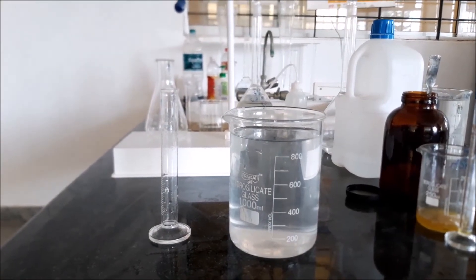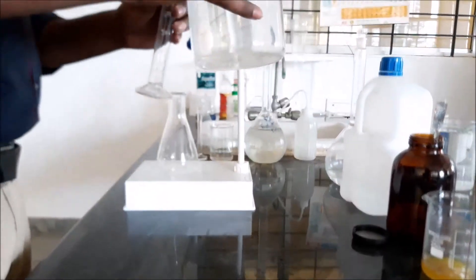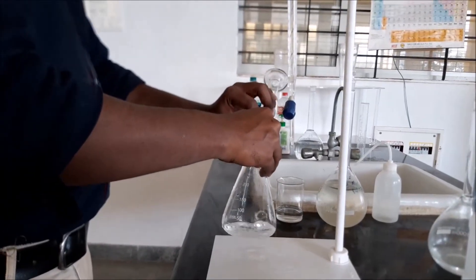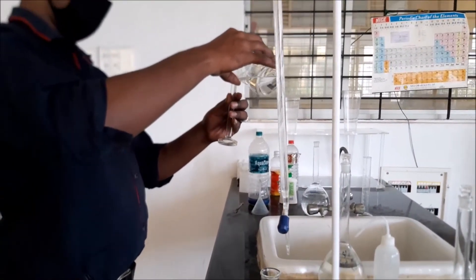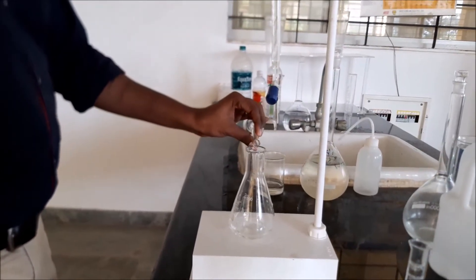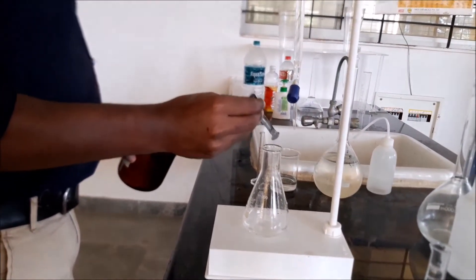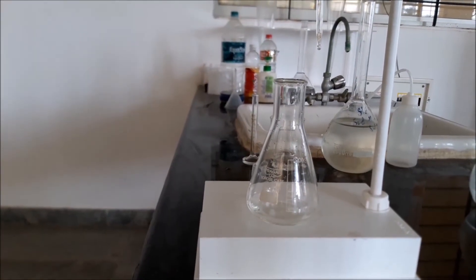We have taken the second sample, to which four ml of chlorine water was added. We take 25 ml of sample and add it to the conical flask, along with two ml of acetic acid and a pinch of potassium iodide indicator. Again, there is no change in color, so residual chlorine is absent. Note down the value as zero.